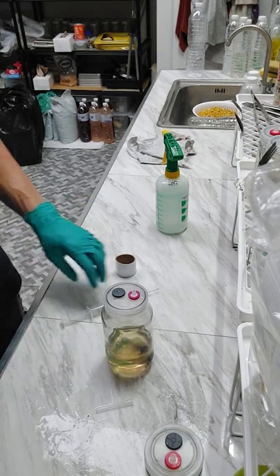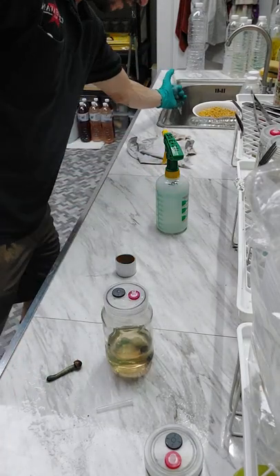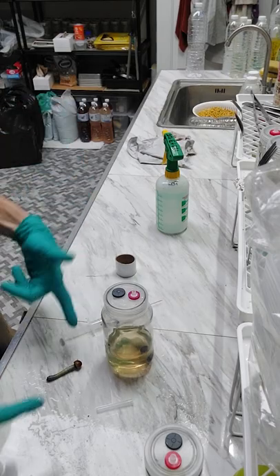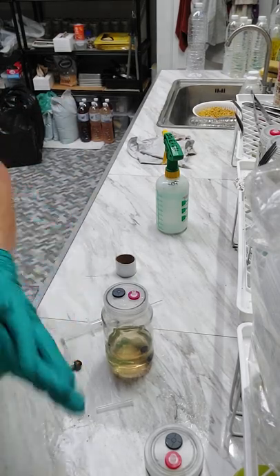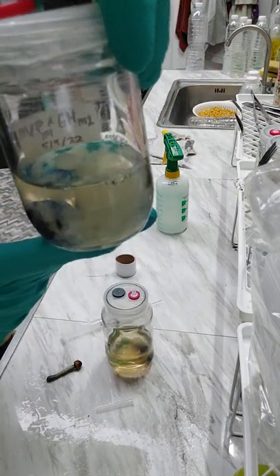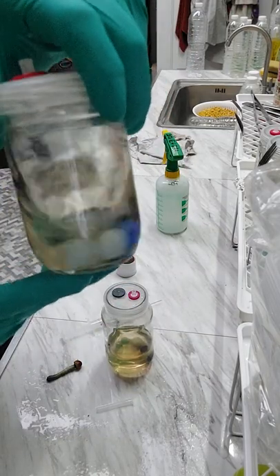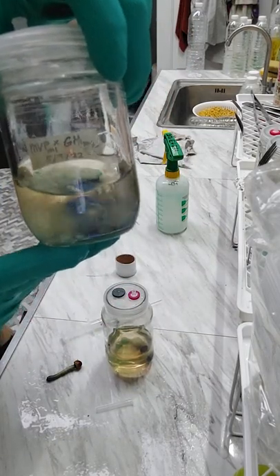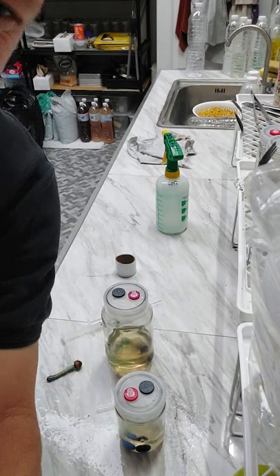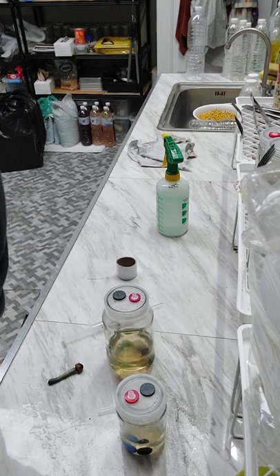This needle is garbage — make sure you don't throw it in the standard bin. I will clear that needle in the sink and then throw it in the biohazard. Then I'll label this guy up here. I've got one that already started last week. Depends on your LC recipe — some people like thick LC, some people like it wispy. I kind of like it on the more wispy side, but that's up to you. Bye bye, see y'all later.